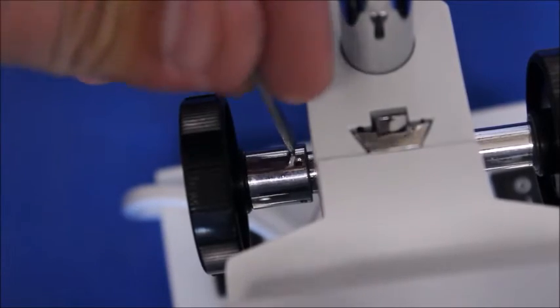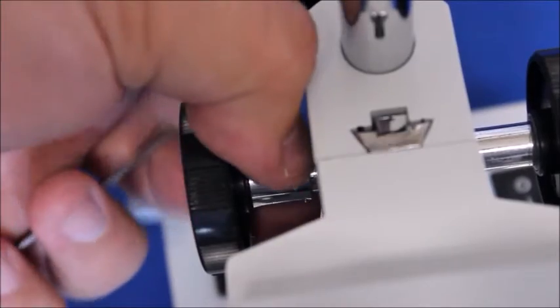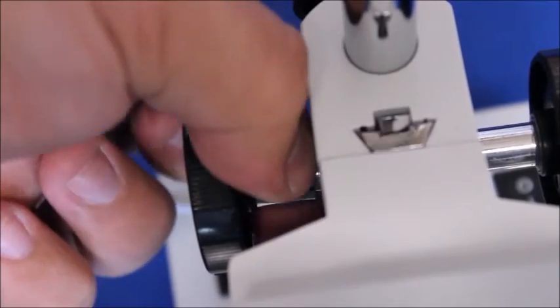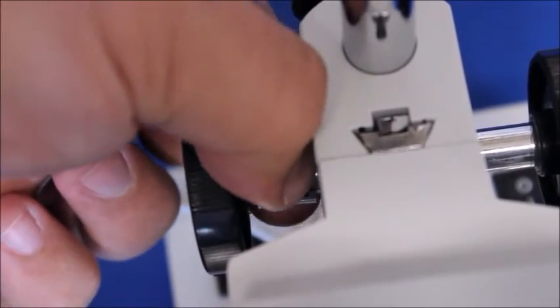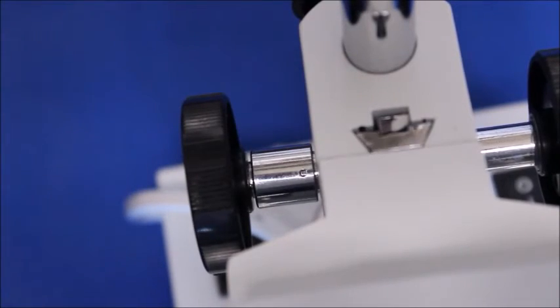So what you want to do, there's holes all the way around. Let's just do the same thing. There we go. And also try to tighten it with your fingers.